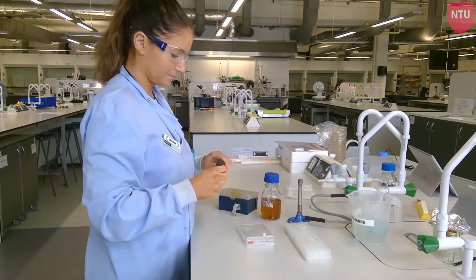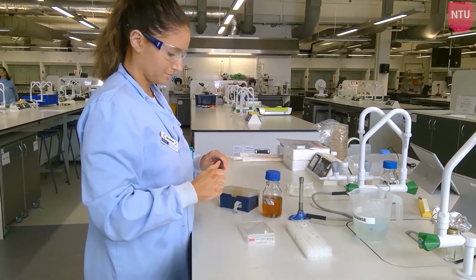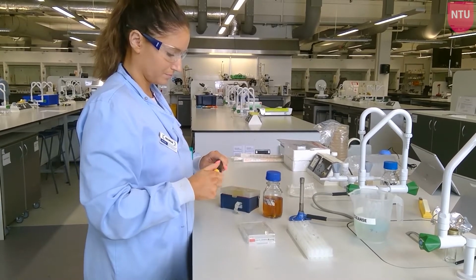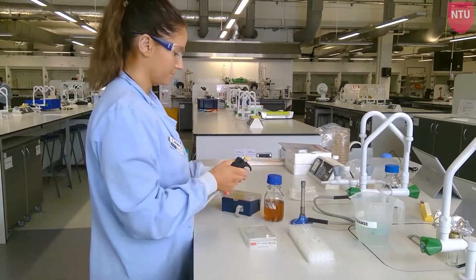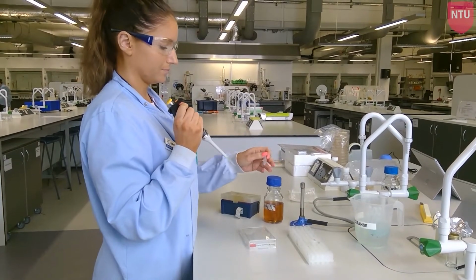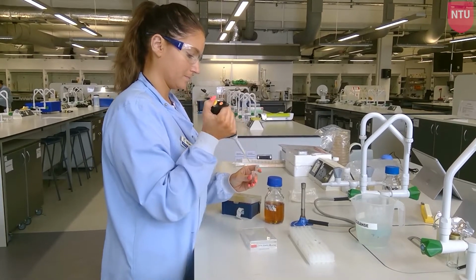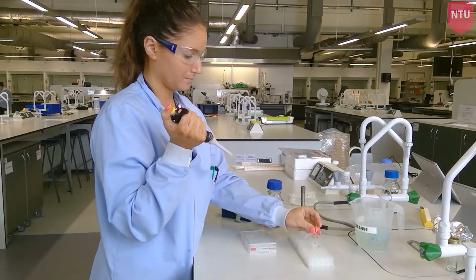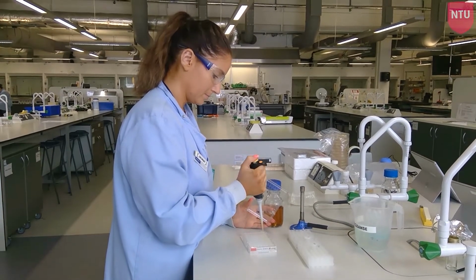Once you have added the 100 microlitres of media to each well that you will use, you need to add the antibiotic to the first well. You should calculate the volume of antibiotic needed to add to the first well to produce the desired final concentration of antibiotic in 200 microlitres of total volume for well 1. Add this volume of antibiotic to well 1, then calculate how much sterile media should be added to give well 1 a final volume of 200 microlitres. Add this volume of media to well 1 also.